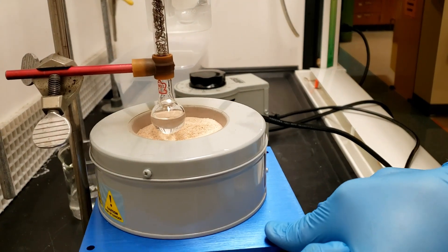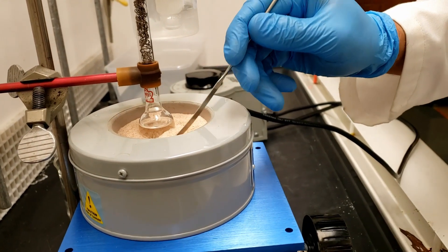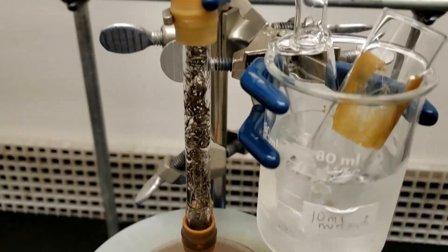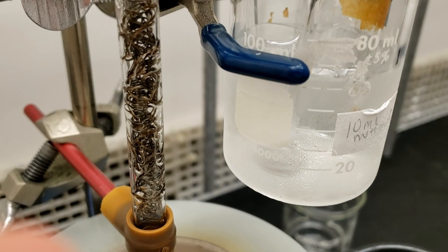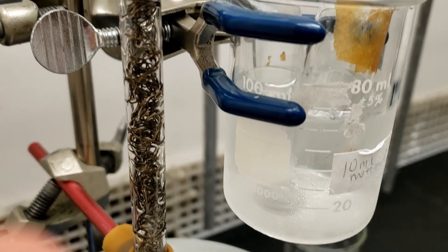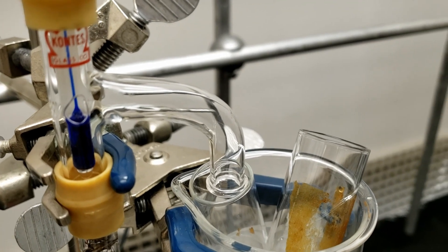As we heat the boiling flask, adjust the sand around it. The more sand that comes in contact with the flask, the more heat will be imparted into it. Manipulate the sand to adjust the drop rate of your distillation. Once the condensation ring moves up the column and reaches the thermometer bulb, you'll see a spike in temperature.